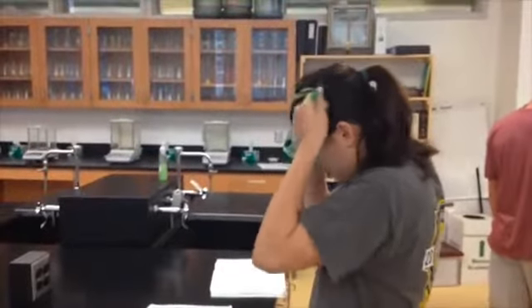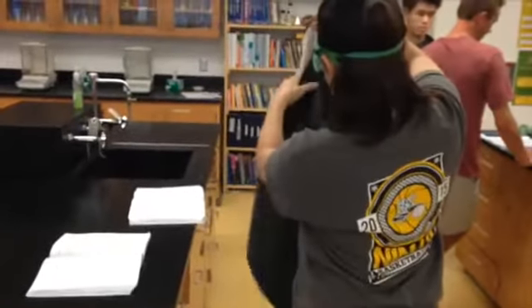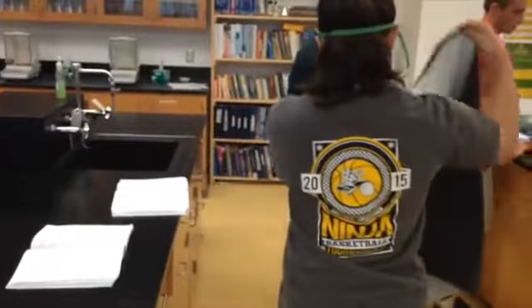And that brings us to our next point: safety. When you enter the lab, it's important to tie back long hair, put on closed-toed shoes, and wear lab goggles. For this lab, you should also wear a lab apron, put the loop over your head, and tie it behind your back.